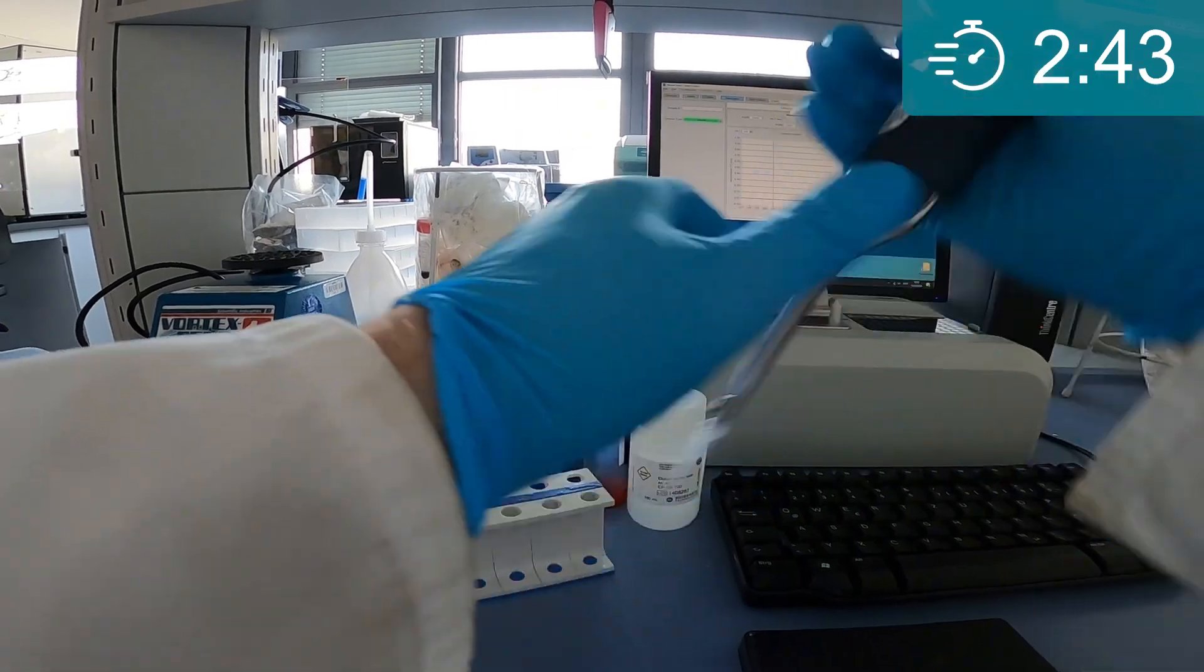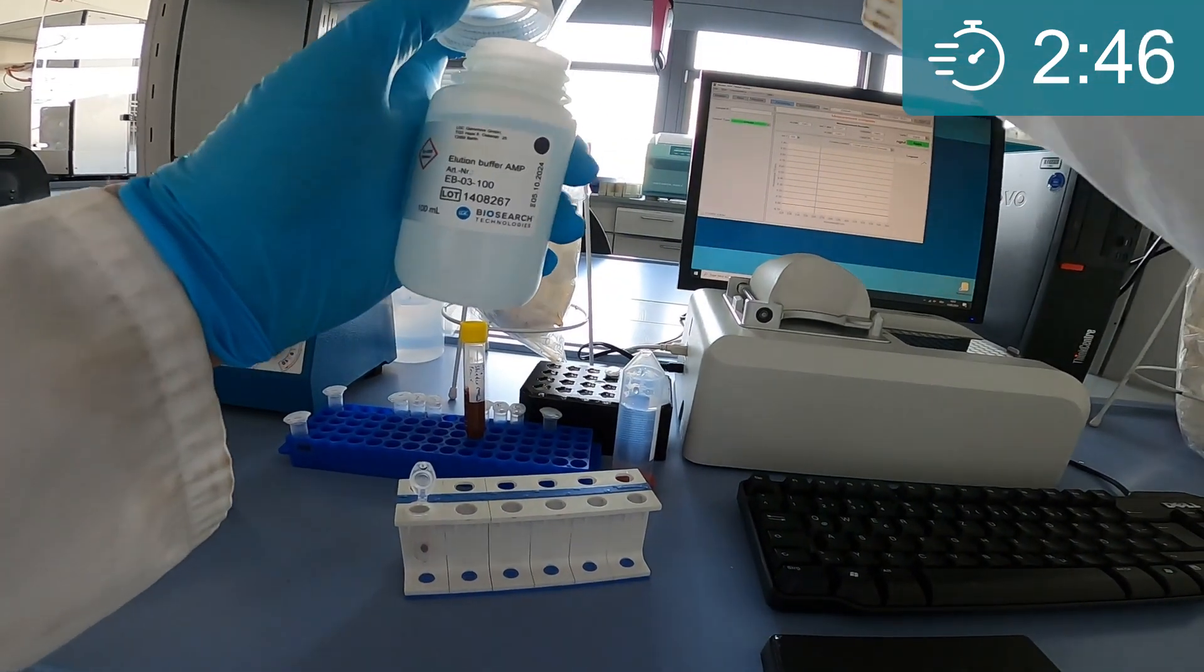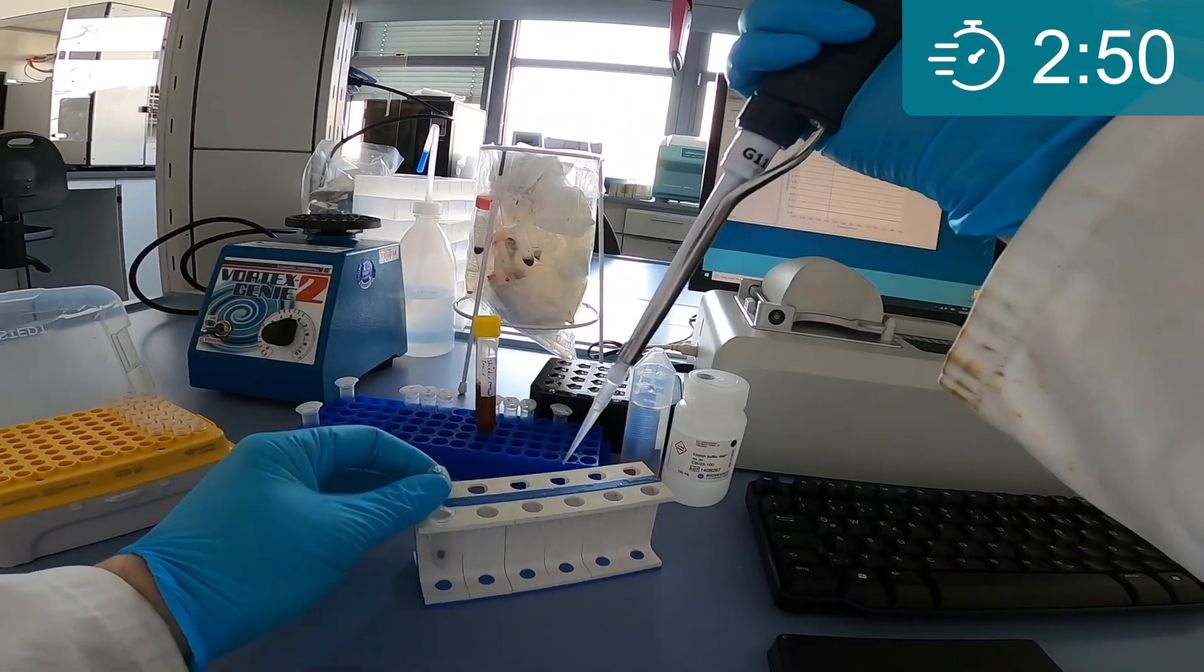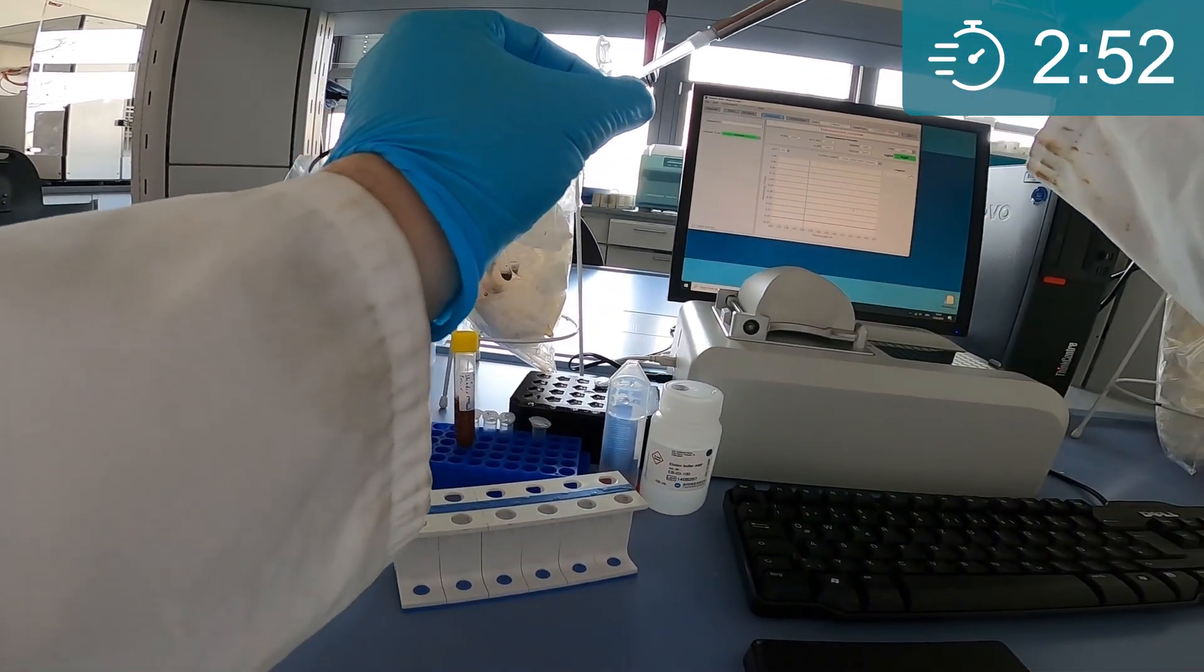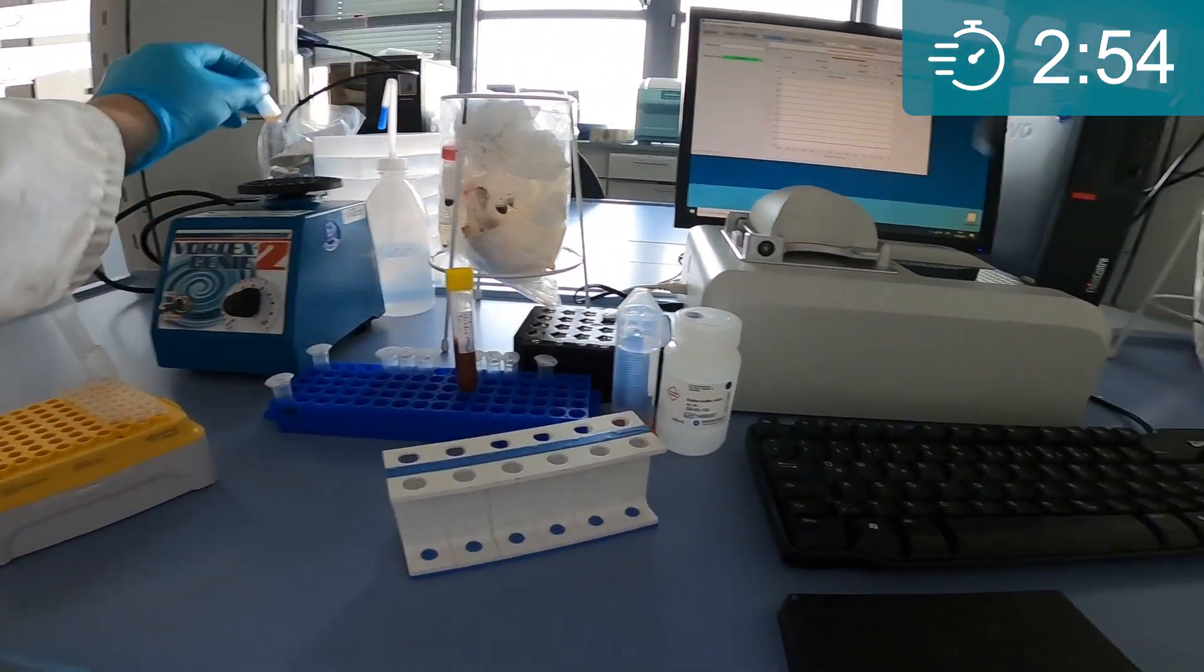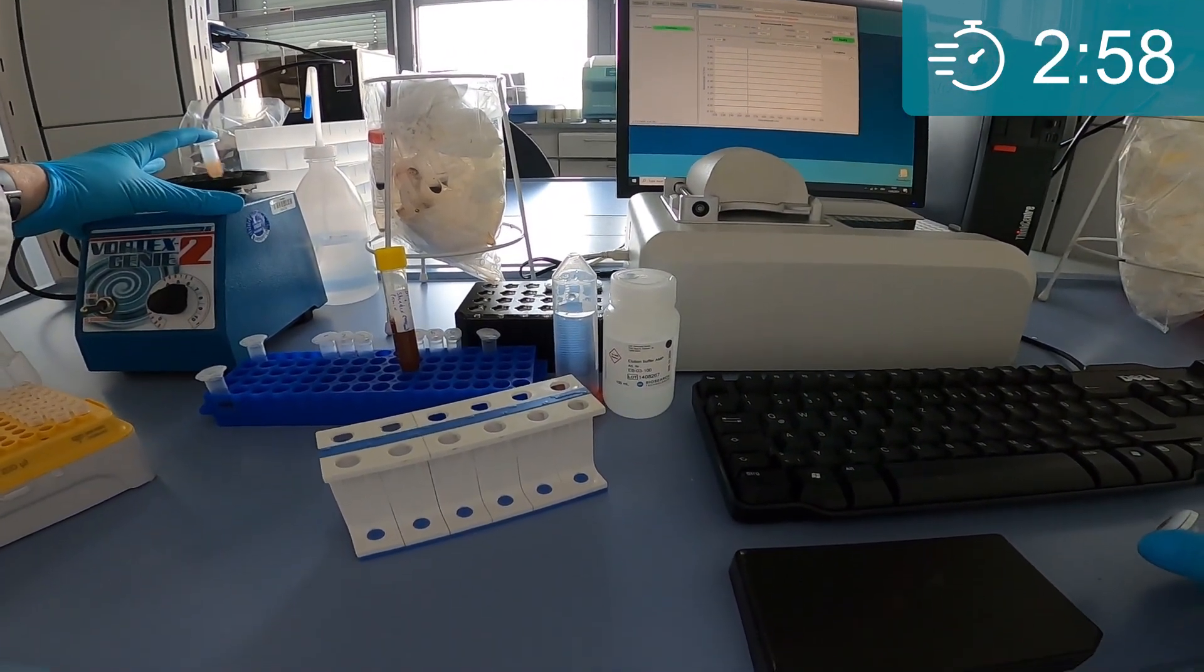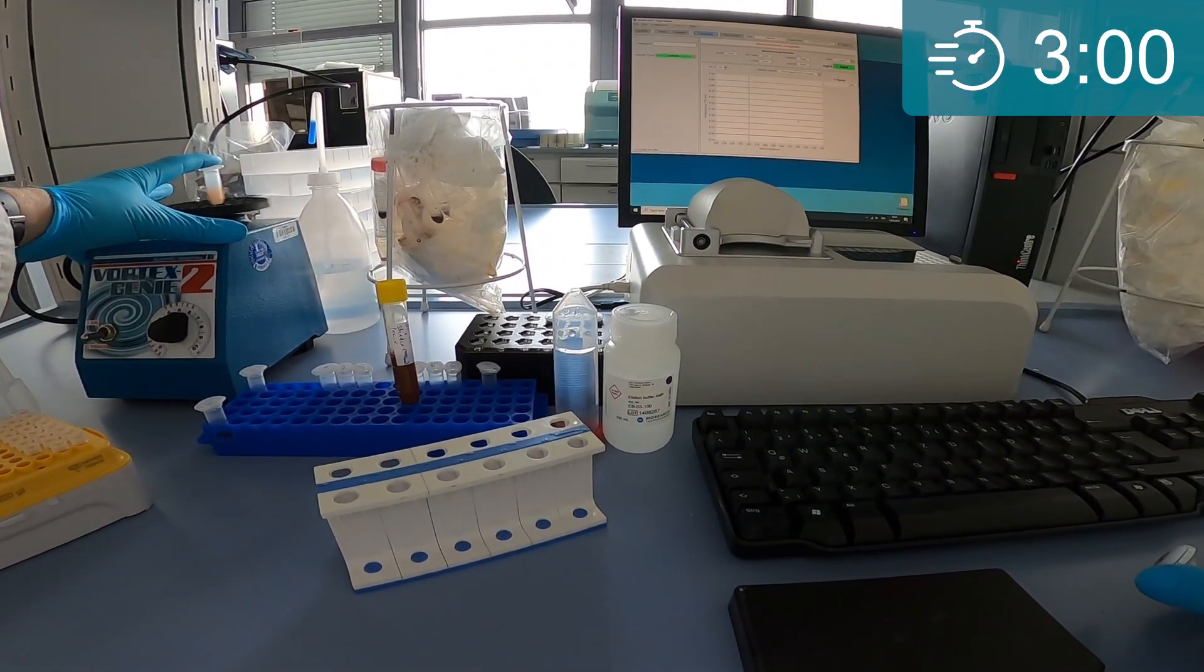Now add elution buffer to the separated beads. One purification using our core kits is calculated to 200 µL of sample lysate input, resulting in 100 µL of DNA in elution buffer output. However, the chemistry is scalable.